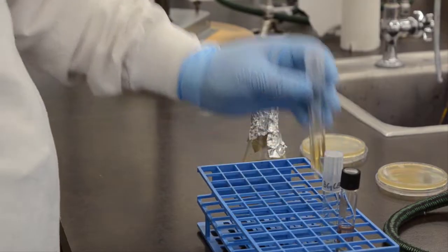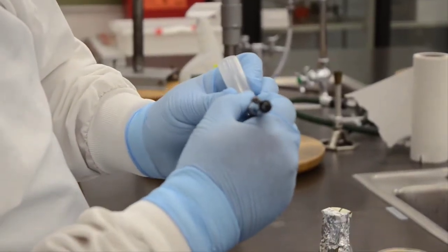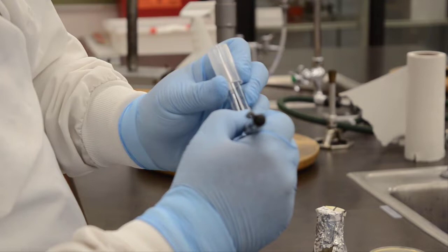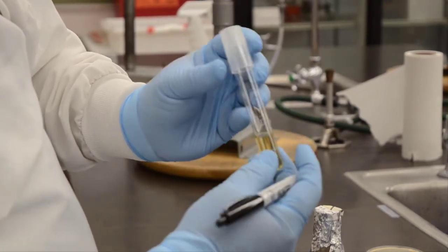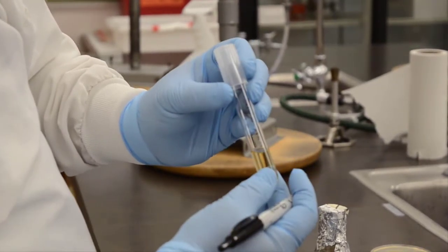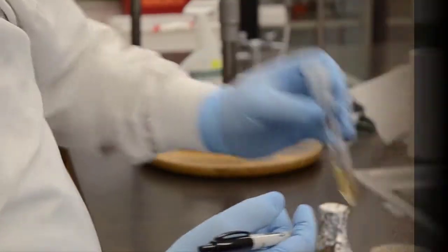Today we're going to be talking about how to inoculate tubed media. Tubed media usually contains a broth or some solid medium like agar that's nutritive for the bacteria. The first thing you need to do is, of course, label your tubes properly, and that should include the organism that's in there and any identifying information for yourself and the lab that you're in. Here we see unknown gram-negative bacillus, a date, initials, and lab B.